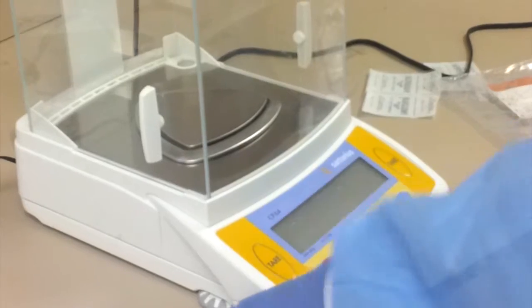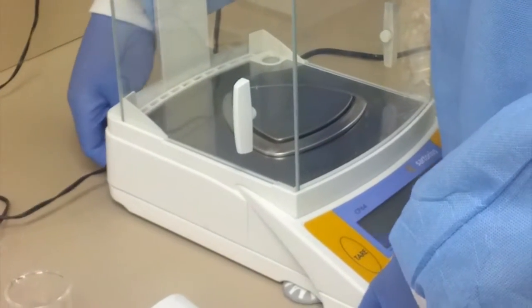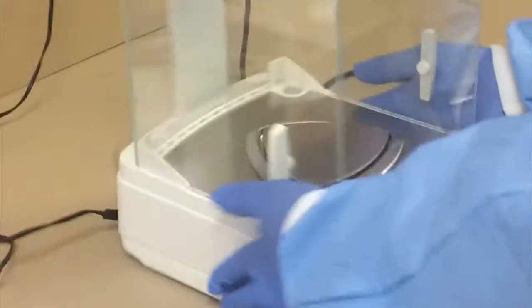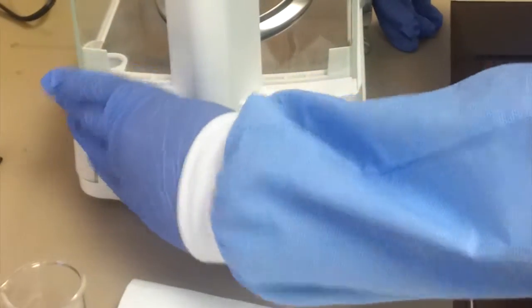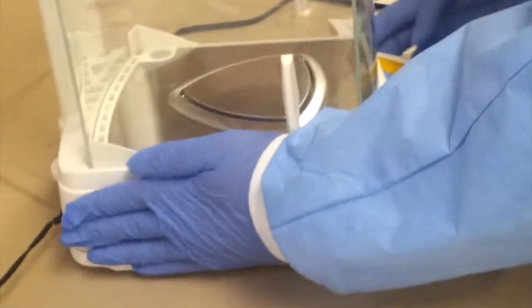But is our balance truly showing us the correct weight? In order to double-check this, we are first going to power down the machine and unplug everything just for safety precautions. We're going to remove this cage, and to do that, we just pop the switch back here, and that easily allows you to remove the top cage portion.